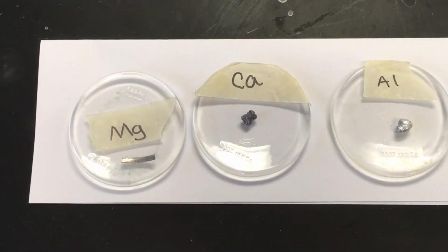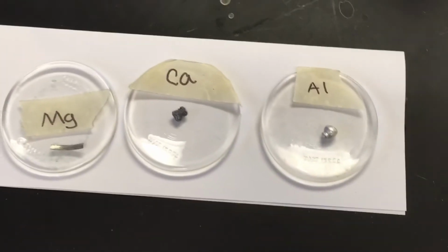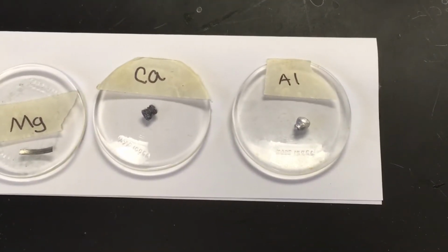Take a picture of calcium, crop it, put that in your data table of what it looks like before the reaction. And then here's a picture of aluminum. Same thing here. Take a photo, take a screenshot of this, and then crop it. I don't want to see all three elements in each spot. I want you to crop it and only show the element that is being asked for in that particular spot in the data table. All right, pause it, do that now, and then come on back.